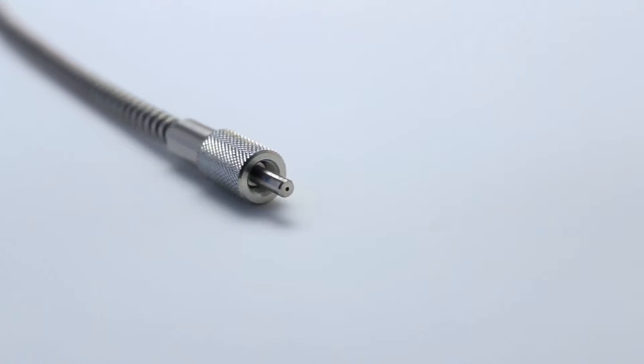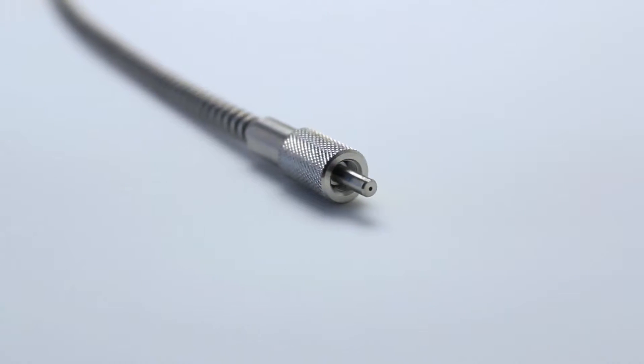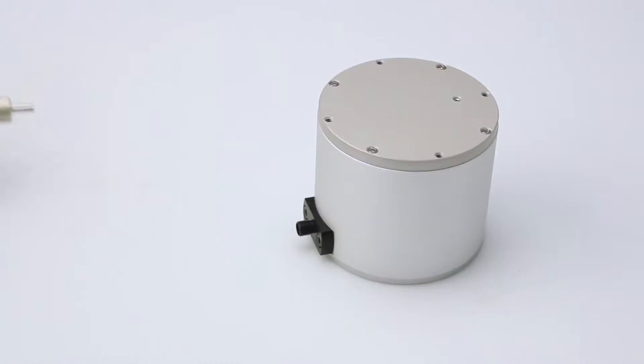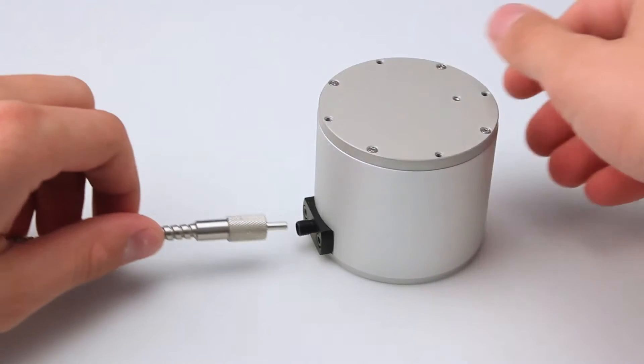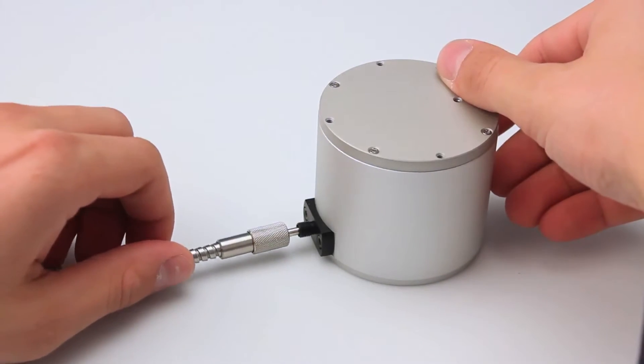Be sure to have a system calibrated for irradiance. Connect the spectrometer to the sphere with the supplied fiber optics cable.